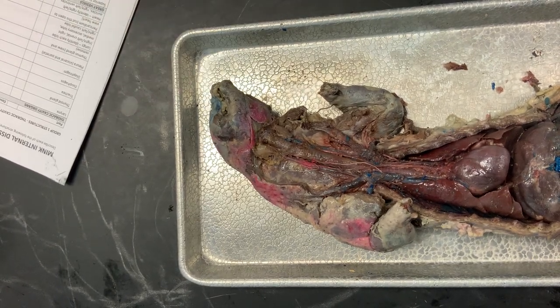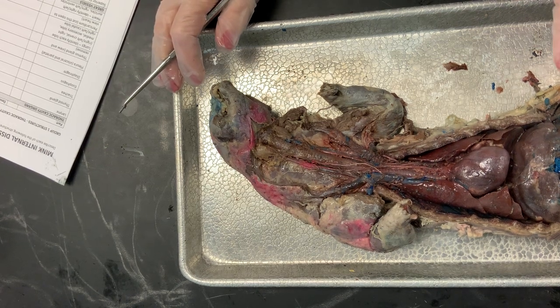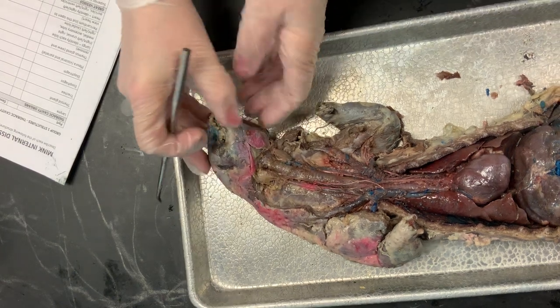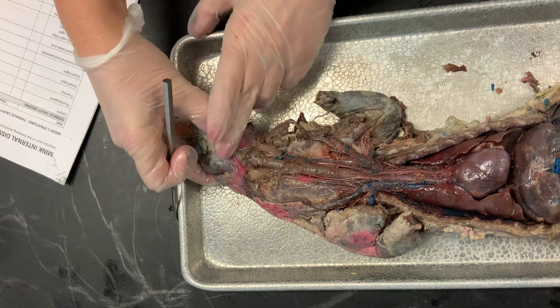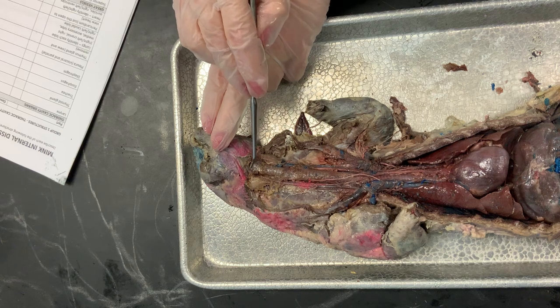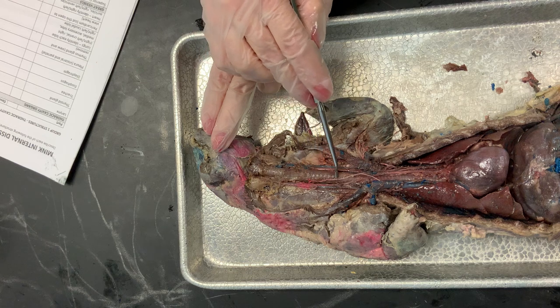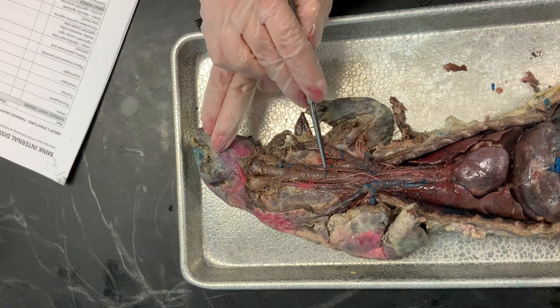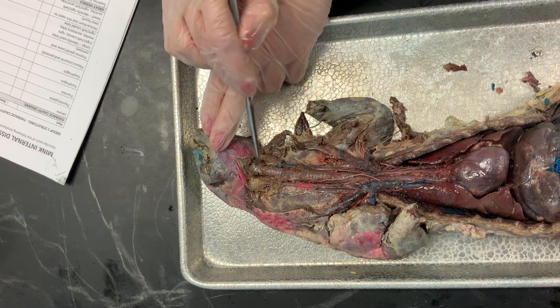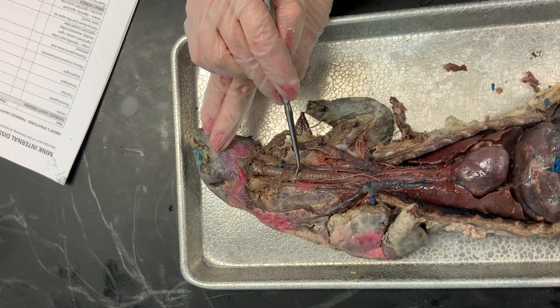We are going to take a look at group one structures, specifically the organs of the thoracic cavity. Starting up here at the top under the chin area, we first see the larynx. The larynx is this smooth structure right at the top of the trachea. The trachea has those tracheal rings on it and is pretty easy to identify. At the cranial region of the trachea, we see the larynx — larynx here, trachea here.